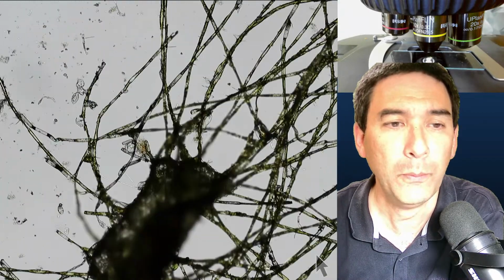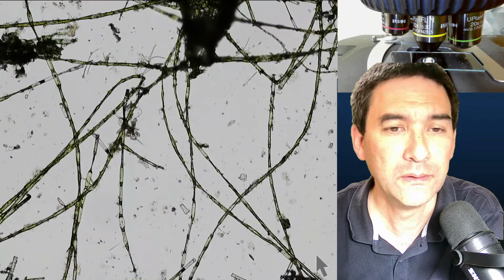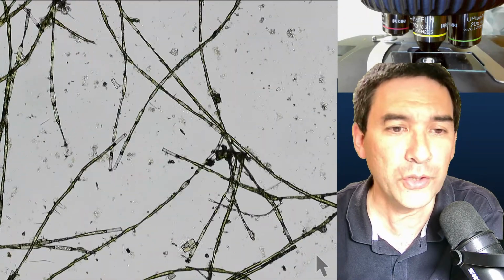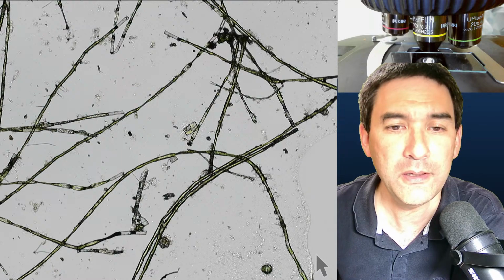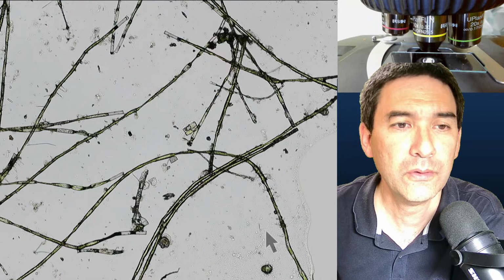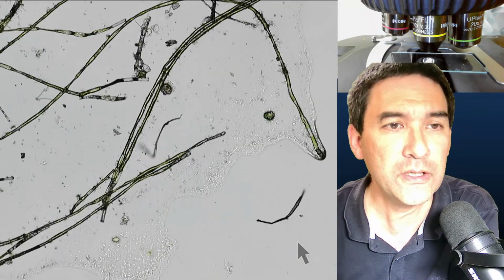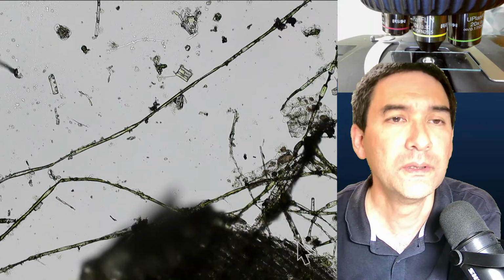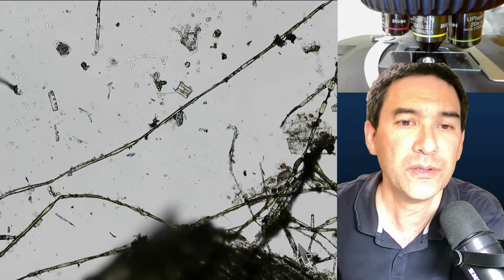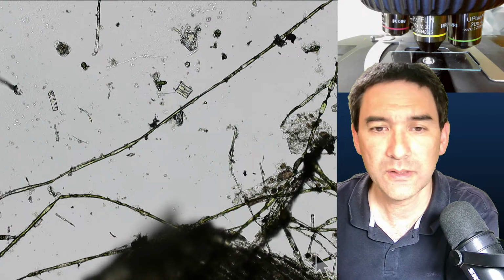Okay, there were a whole bunch of rotifers in here as well. And when they lose water, then they completely shrivel up. There seem to be some tiny diatoms maybe over here. Let's have a look how this actually now looks like once you add some mounting medium as well. Yeah, these are diatoms. Up here, and we do the same thing.